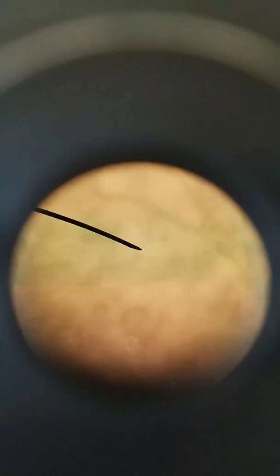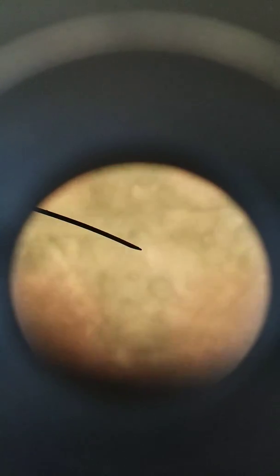We switch to the 40x objective, high power, total magnification of 400. I know it's a bit hard to see because we're so zoomed in, but we are in focus. See, we're at an intersection of the grid right there. So I'm going to move it over to the side. We are at less than a square, and that's actually half of a millimeter. Half of a millimeter is 500 micrometers. So at a total magnification of 400x, our field of view diameter is 500 micrometers.